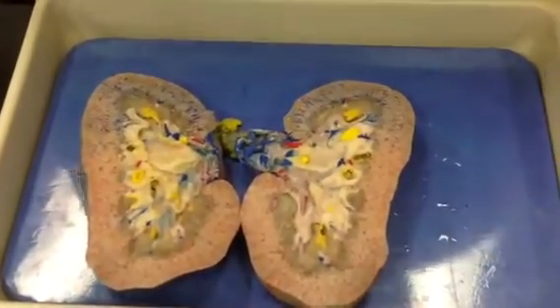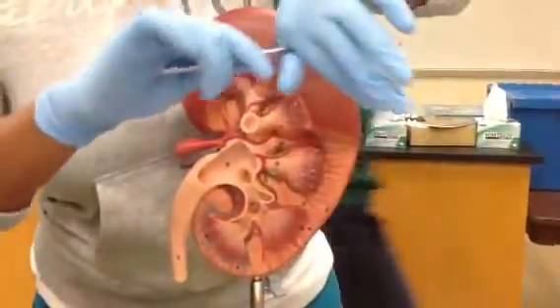Can you grab me that one, Ellie? I'm not going to touch this one, but place it right there. Thank you.